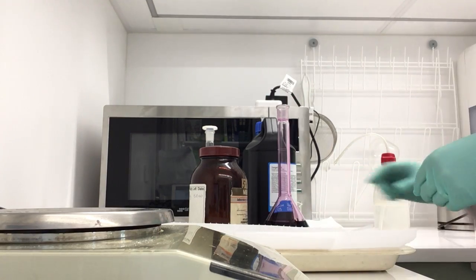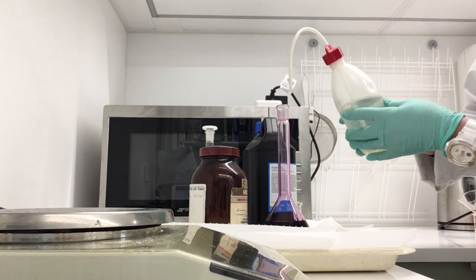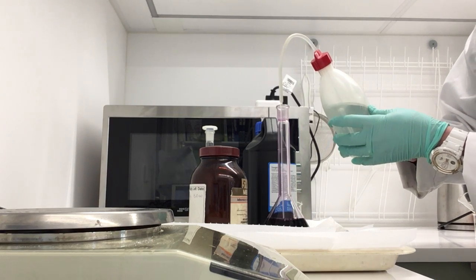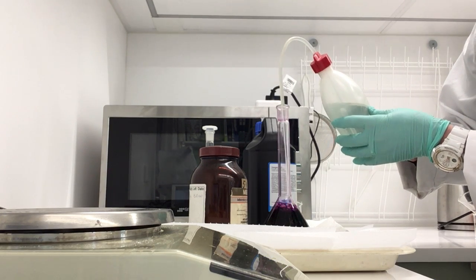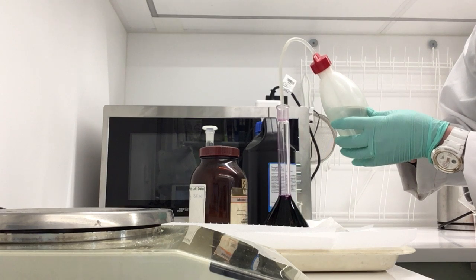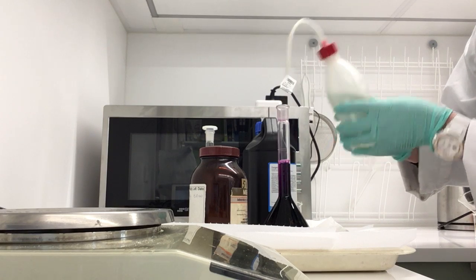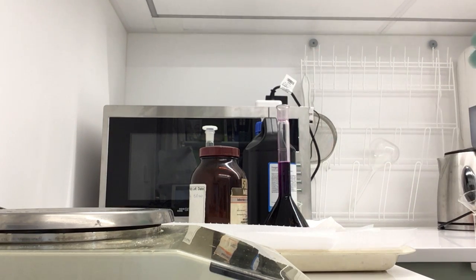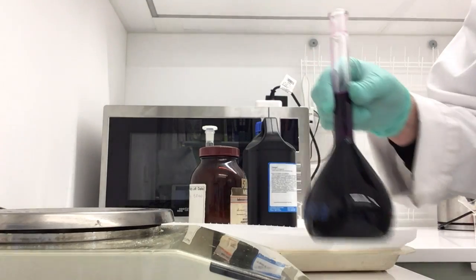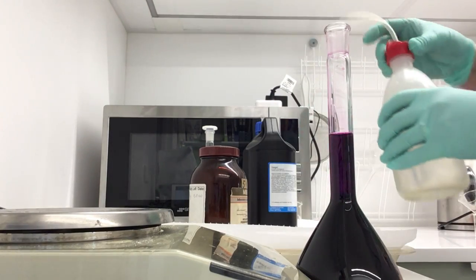Okay, and now I shall make that up to the mark with water, and I like to get it to about there, so it's just below the mark.